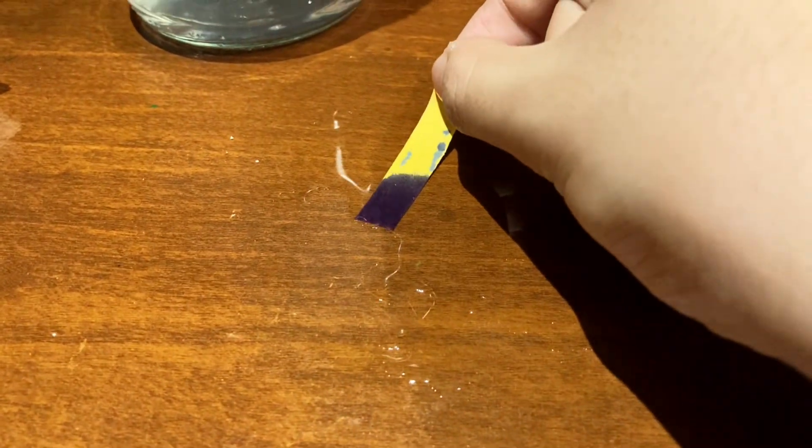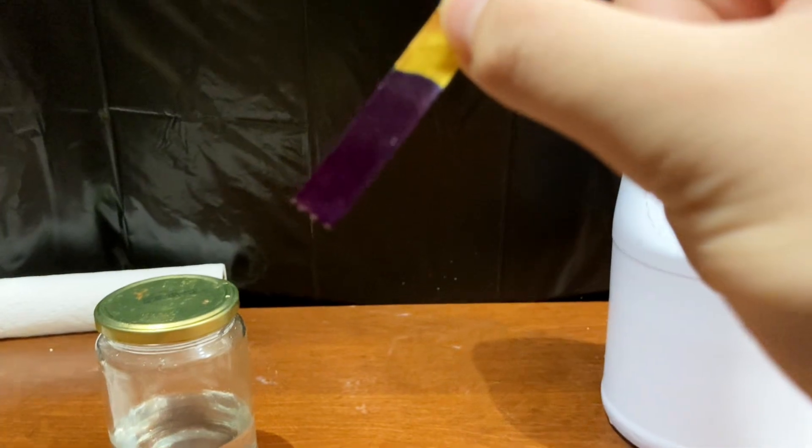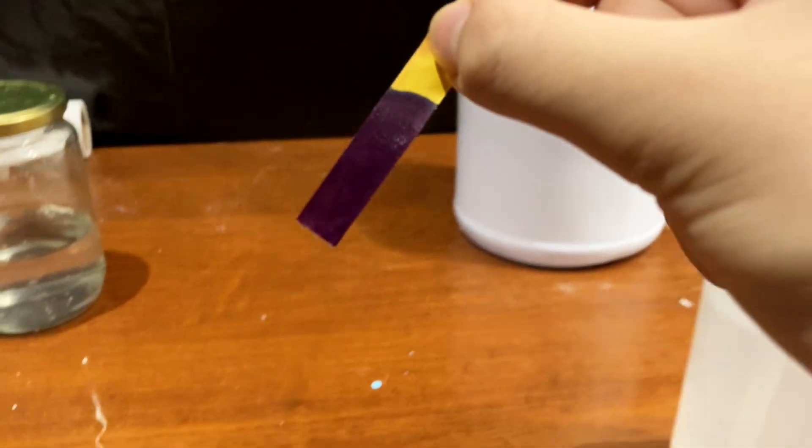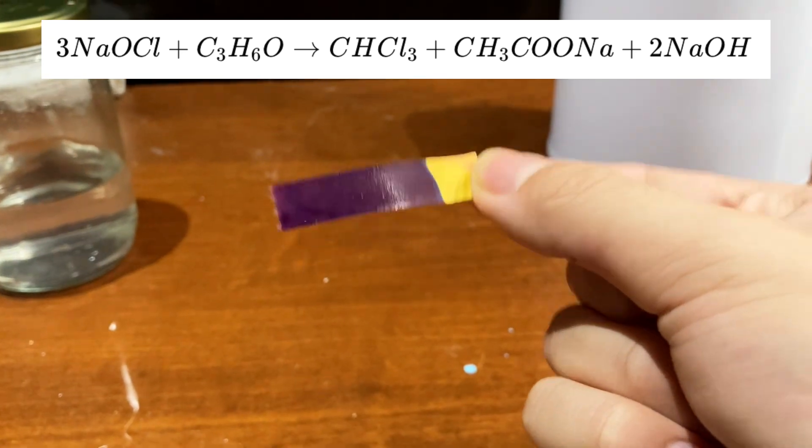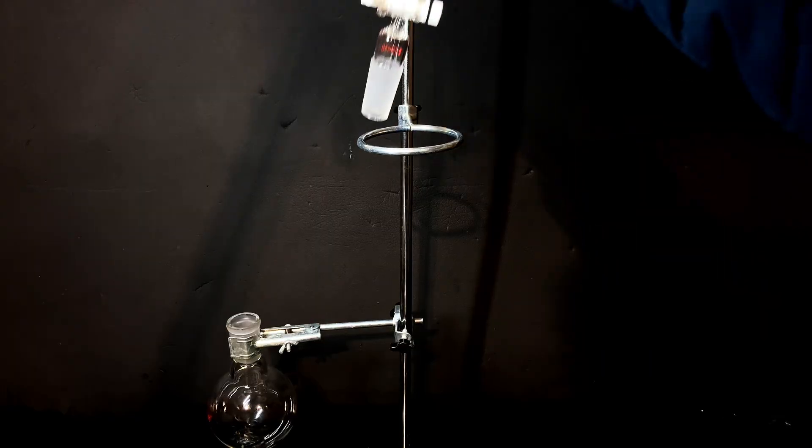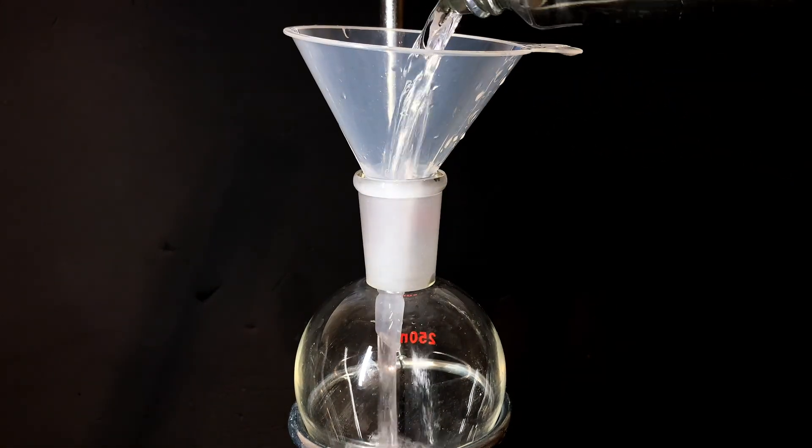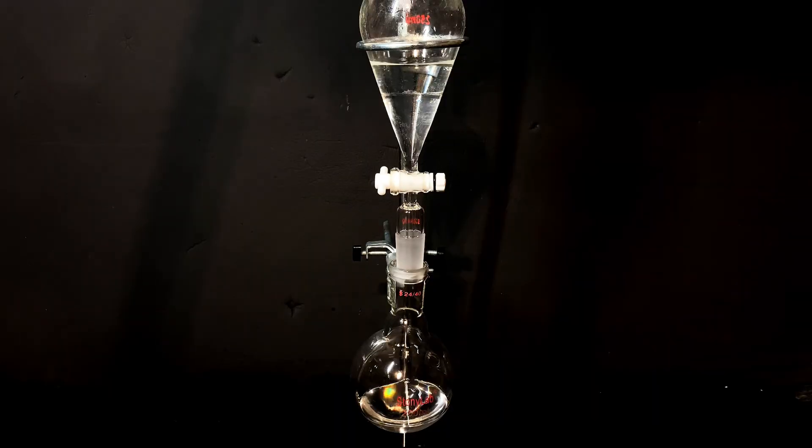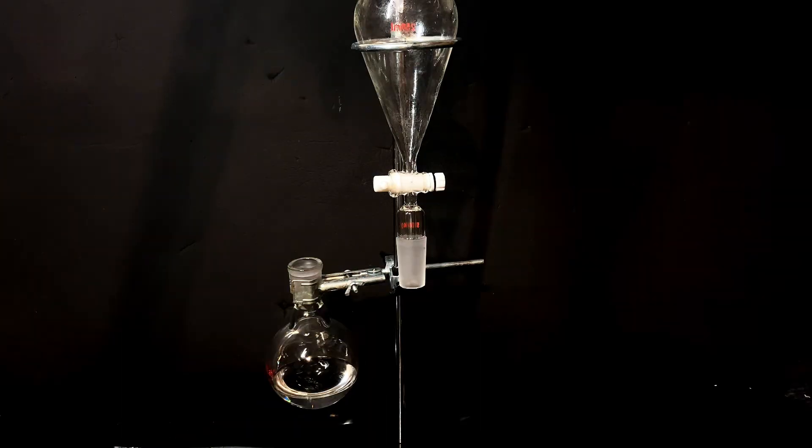I also accidentally spilled some of the decanted solution, which is pretty harmless, but you can see how the pH is really high, which was expected. As you can see from the equation, sodium hydroxide is a side product. Now pouring off as much water as I could, I transferred all of the chloroform and a bit of the water into a separatory funnel. Then, after draining out the chloroform layer which is denser than water, I drained out the aqueous layer as waste as well.